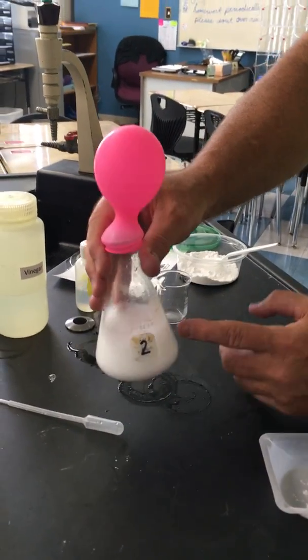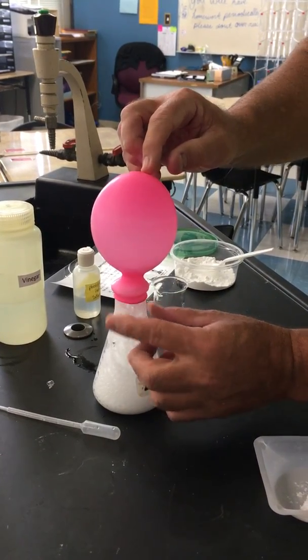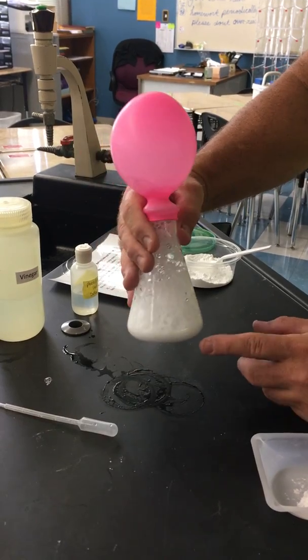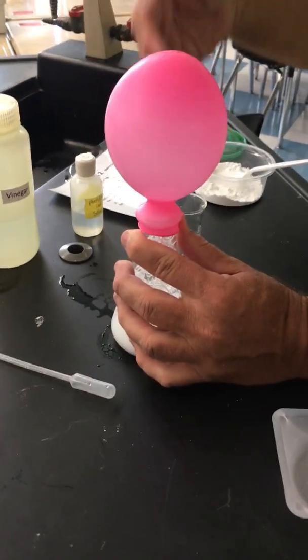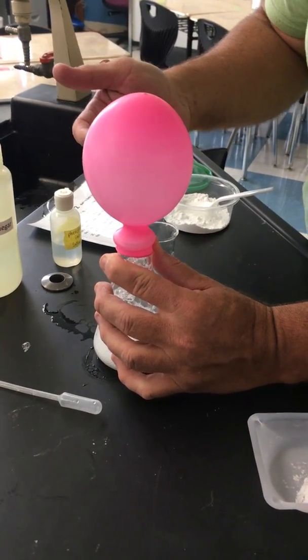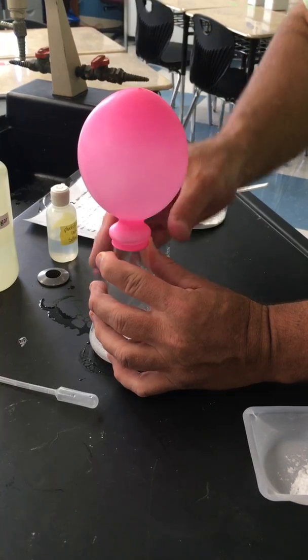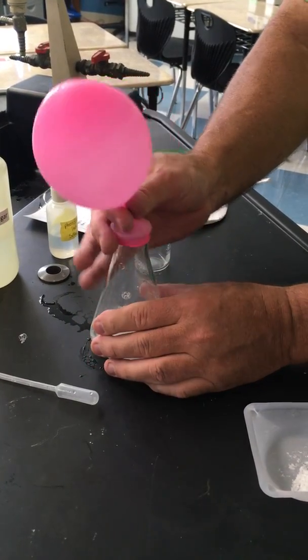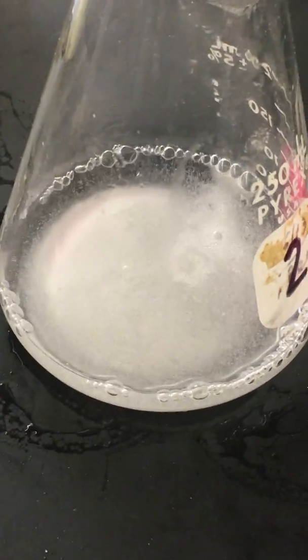You notice one thing is fizzing like crazy. You're producing a gas. And I can't see any pink in there, but there's supposed to be pink inside this. But regardless, we produced a gas. A gas is a new substance, so this should be a sign that something chemical or physical happened based on what you think. So when we're done, for safety, we're going to take that off. All right, there's a gas made. All right, now we're going to move on to station 3.